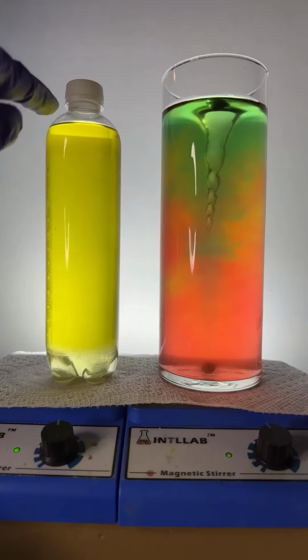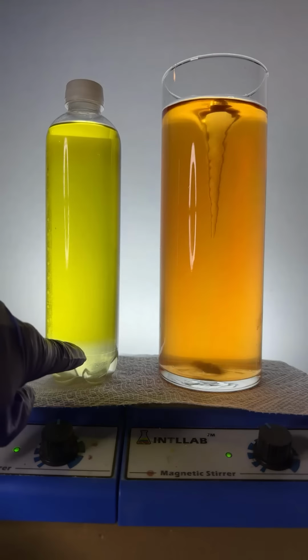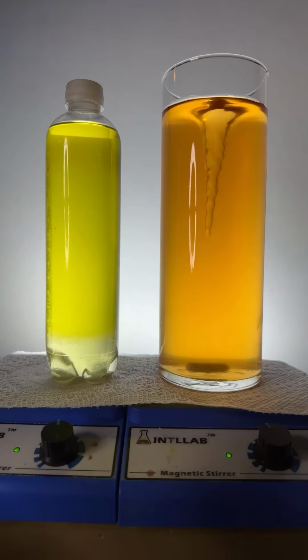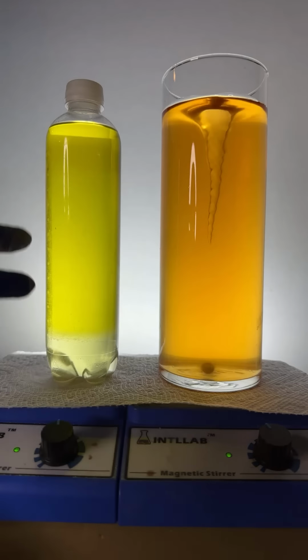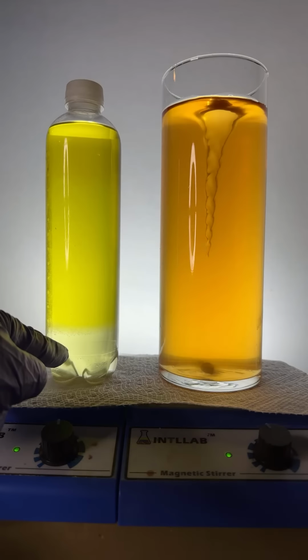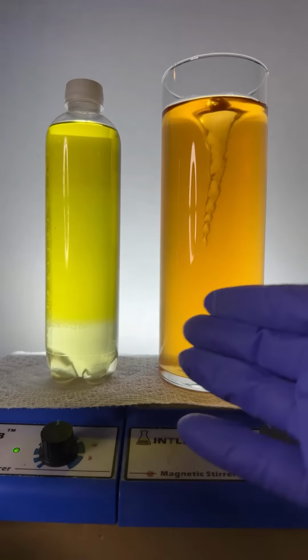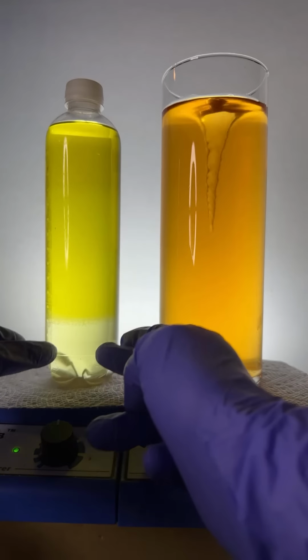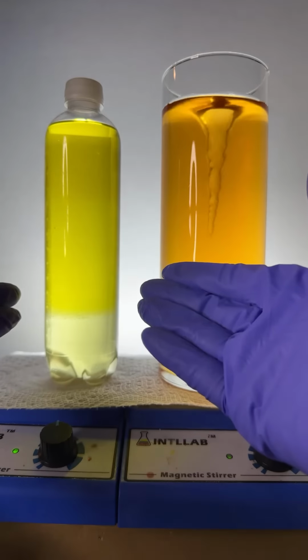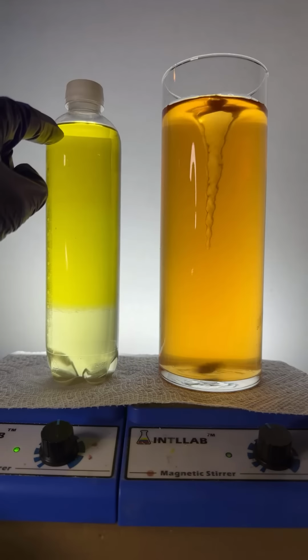But if you look carefully, you can see up here at the top, it's got a darker yellow color, and down here at the bottom, it's got a lighter yellow color. That's because the indicator dye goes into the alcohol layer much better than it goes into the saltwater layer. Again, remember, I added some salt to a mixture of alcohol and water. The salt and the water bind so tightly, it's like two people who fall in love and decide to date exclusively. They bind so strongly, they push the alcohol out.